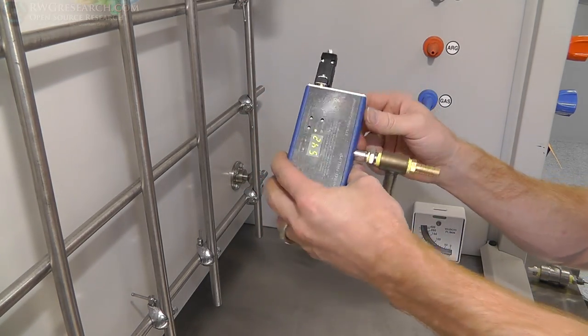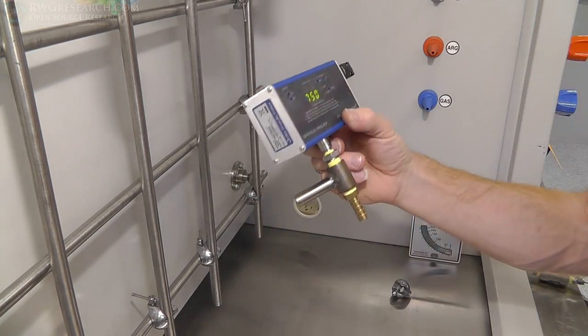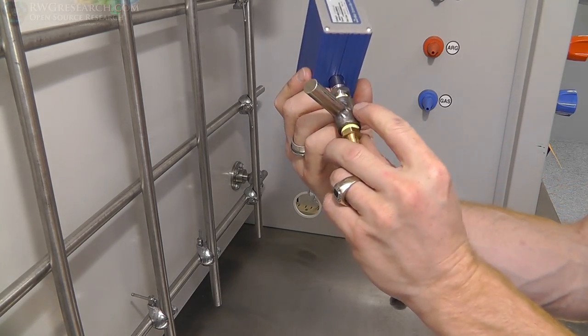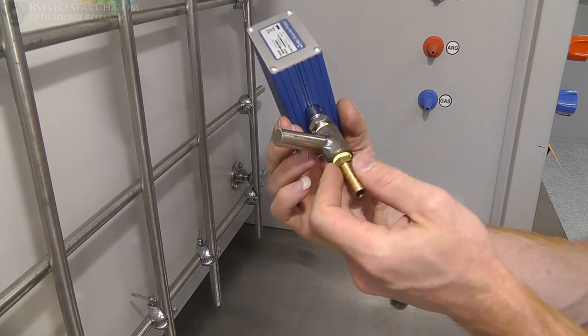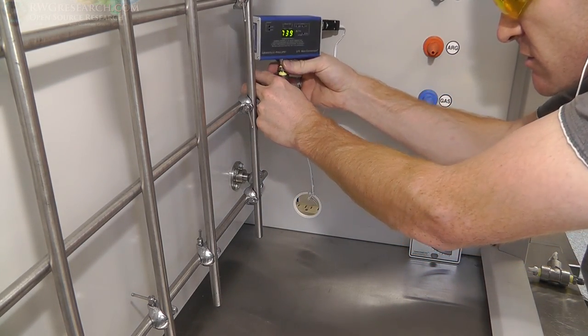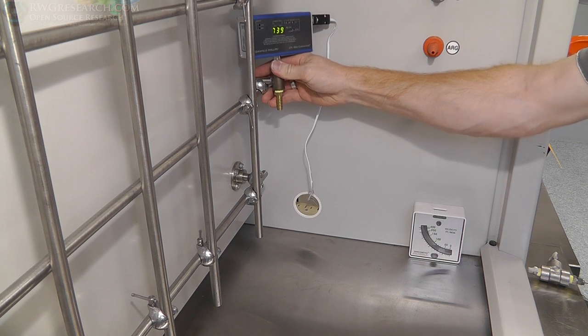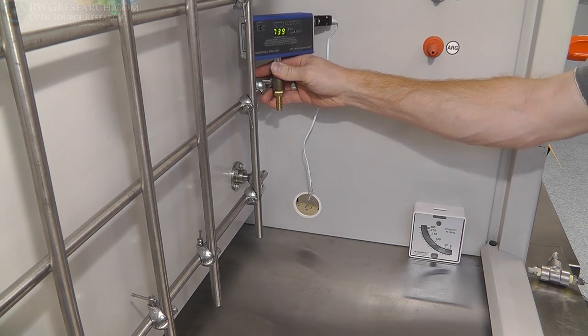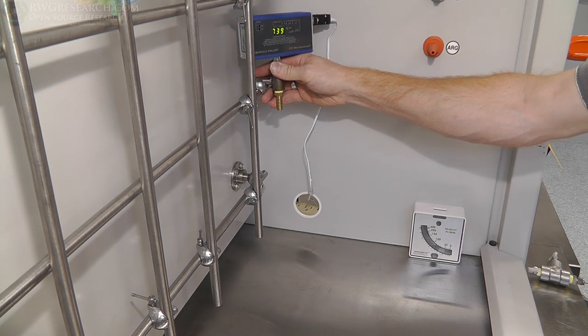And then it has a bunch of data out, but I'm not going to use that for this system, and I want to make this modular so I can plug this to anything else I want. So I've welded up this little bracket right here, which I can't pull the cord any further. And I think what I'm going to do is just mount this right here, like here. Yeah, and then it'll always be in here, because what we want to do is make sure our vacuum side isn't leaking. So if we cap the system off, we can check it. So it's just a verification, because if we get oxygen in this system and it gets in the cold trap, it could potentially explode.